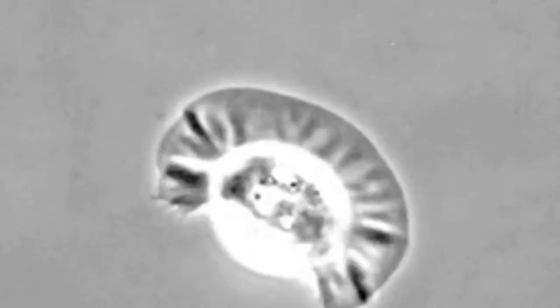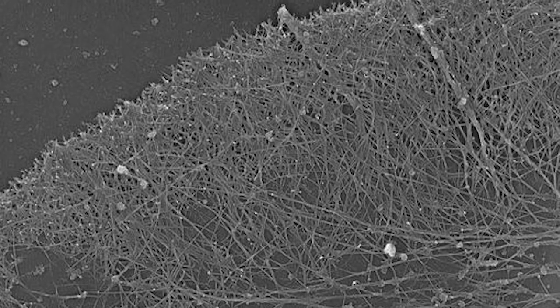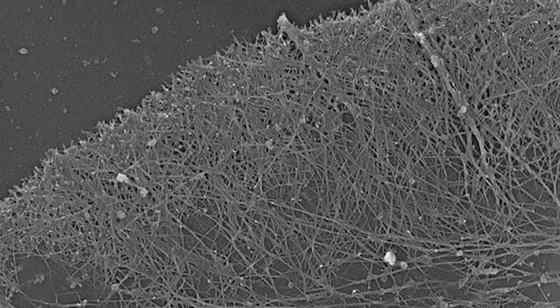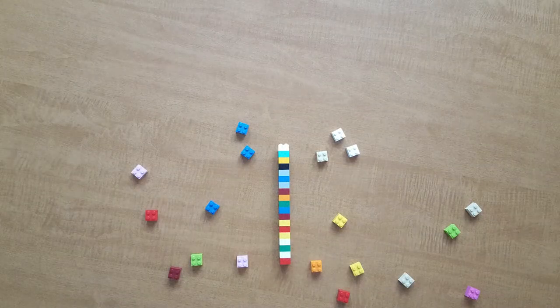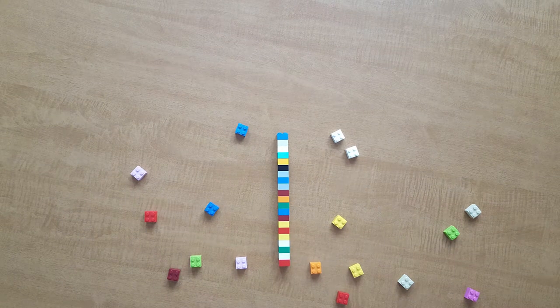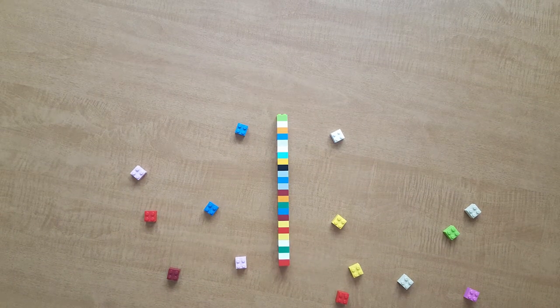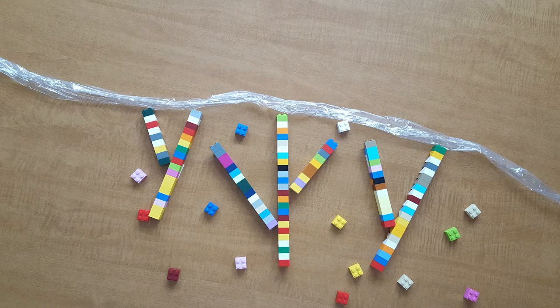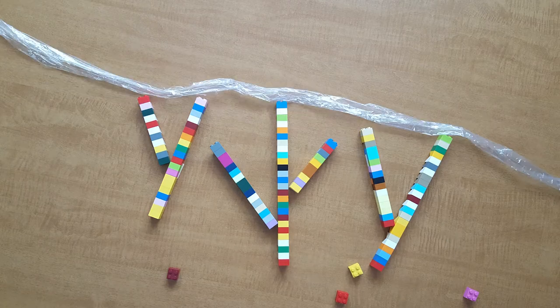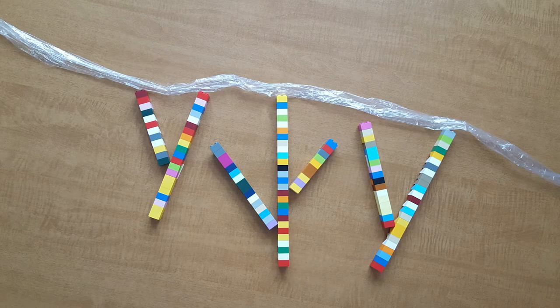Scientists wanted to know how cells like this crawl. When they used electron microscopy on fixed cells, they saw a dense network of cytoskeletal filaments called actin. Actin is a protein that stacks one on top of the other to form filaments. What scientists eventually figured out, mostly through biochemistry experiments, is that as the actin filaments at the front of the cell get longer, that pushes the membrane out, causing the cell to stretch forward.